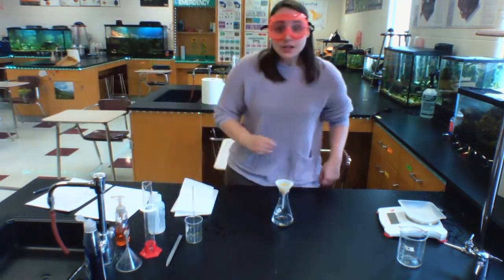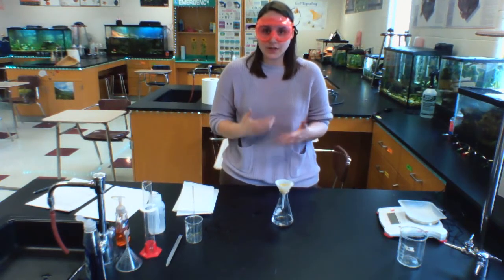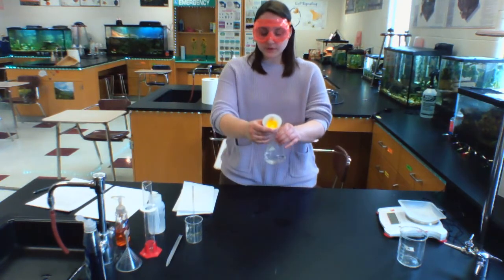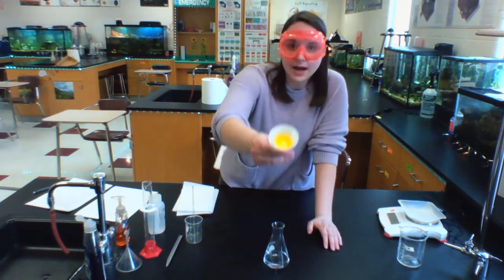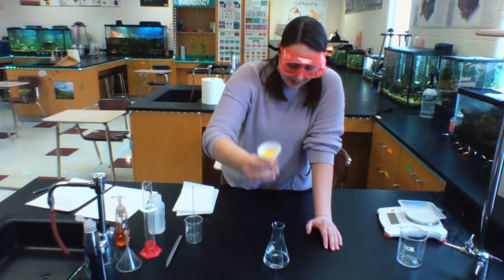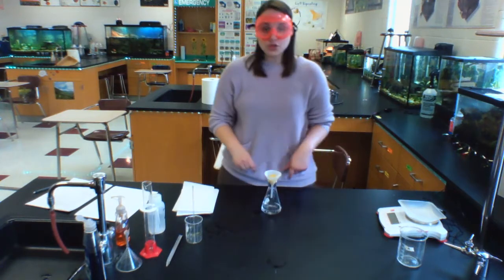Hey, and we're back. So what we did here was just give some time, and I paused the video so that you wouldn't have to sit there and watch, for the water to actually go through the filter paper and into the Erlenmeyer flask. So I just have a water solution down here in the Erlenmeyer flask. And currently this is how the funnel looks with the filter paper inside. It does have that yellow precipitate on it, and I want this to dry.